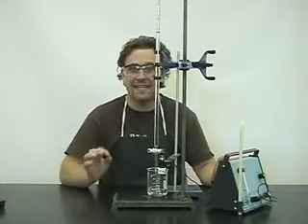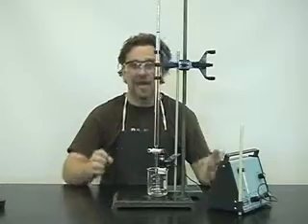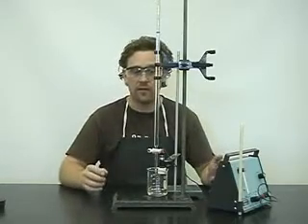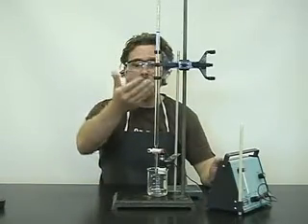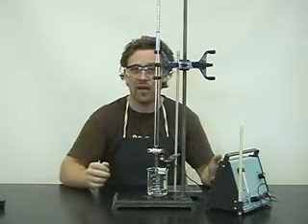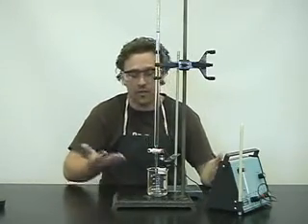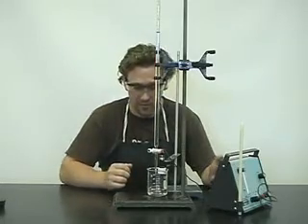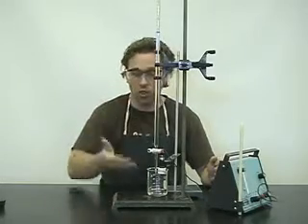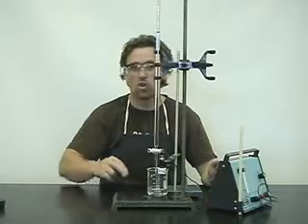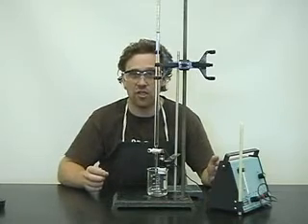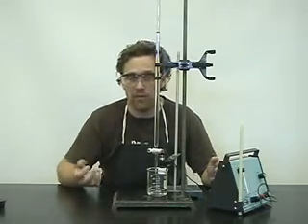I'll also provide you with the data, and ask you to make some graphs. If a strong base, sodium hydroxide, added to a weak acid. And I'll be using acetic acid. We'll add a strong base to a weak acid. We'll draw the titration curve, find the midpoints.